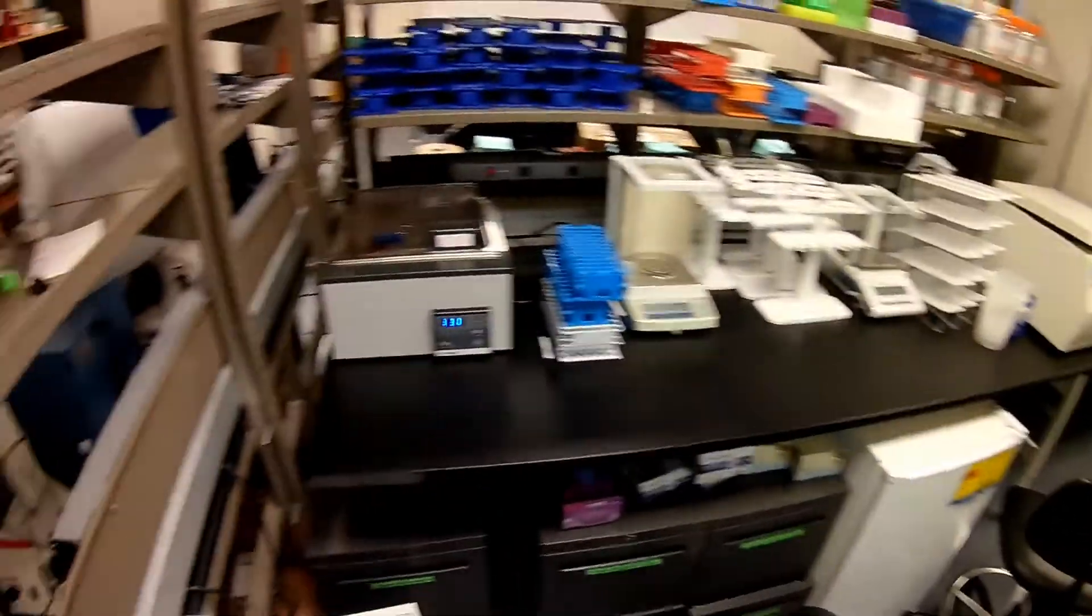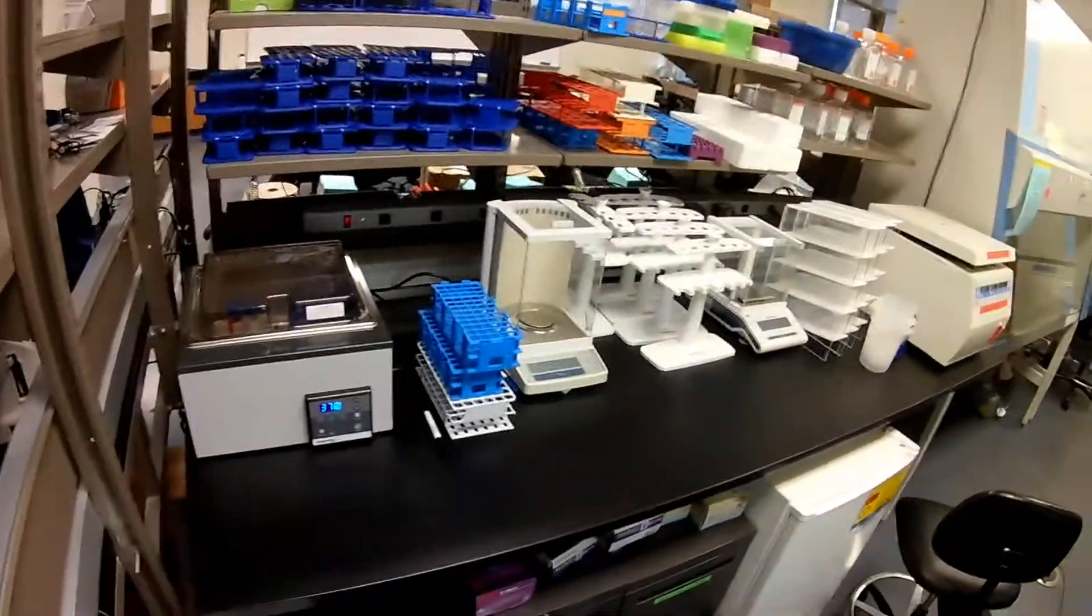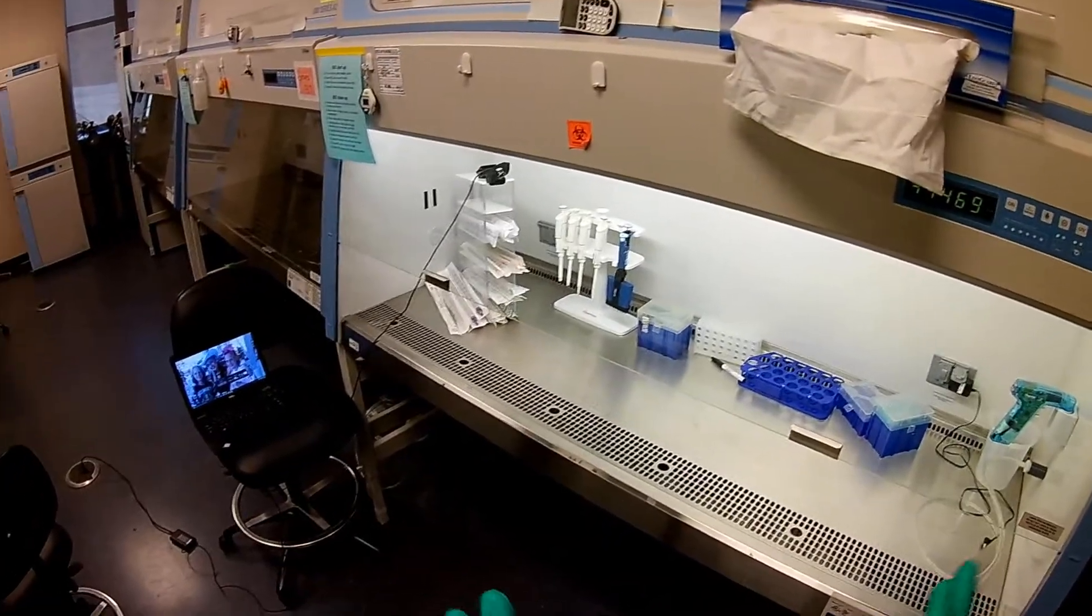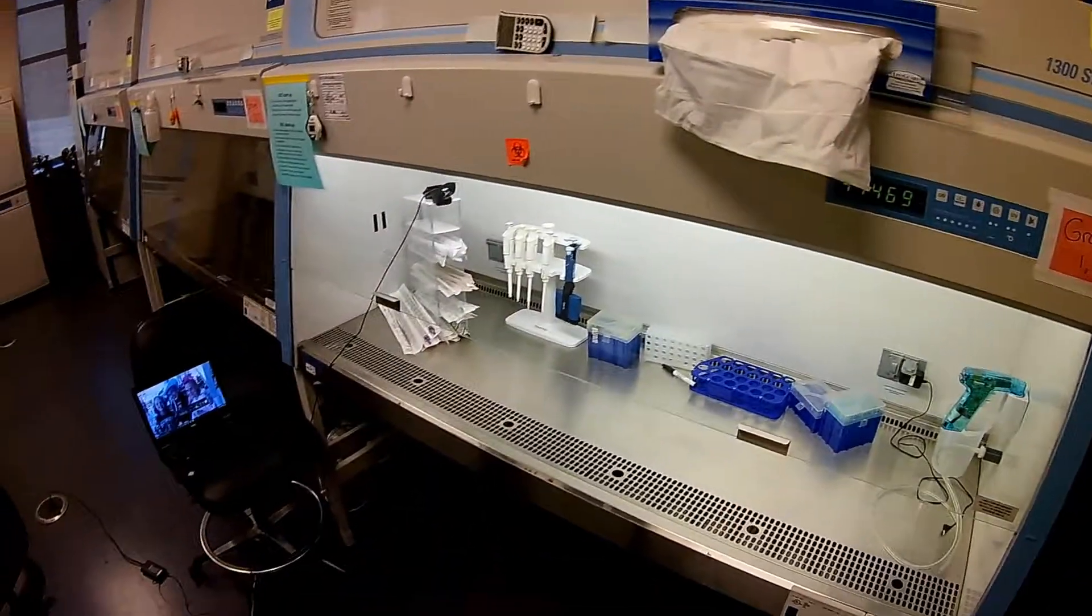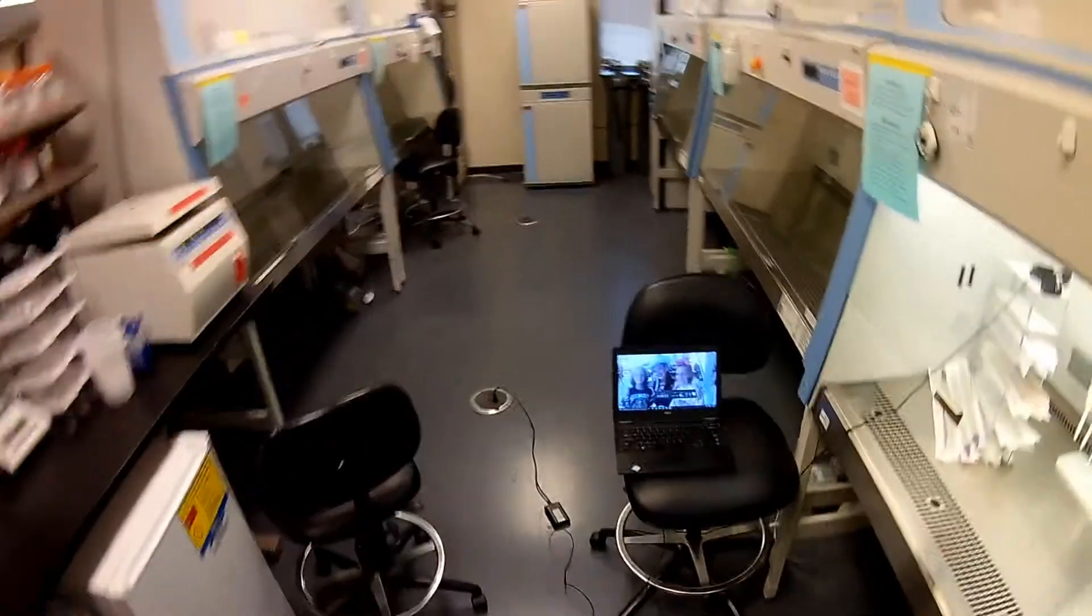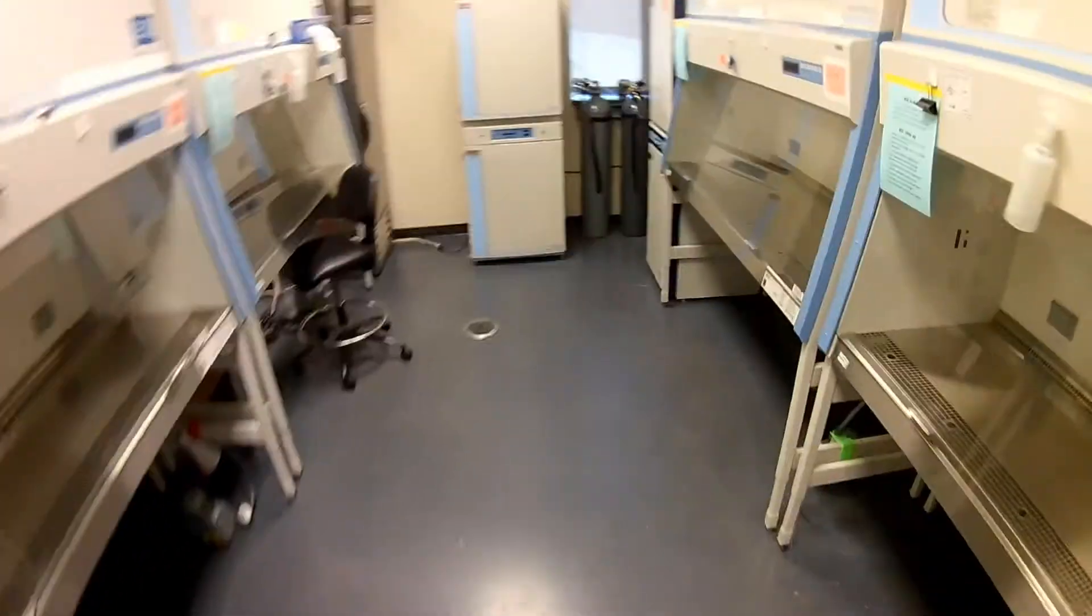We're going to go ahead and take a look at the cells. I've already started warming up my media in the water bath. I've already turned on and set up the biological safety cabinet, so we're going to go ahead and get the cells out and look at them under the microscope.